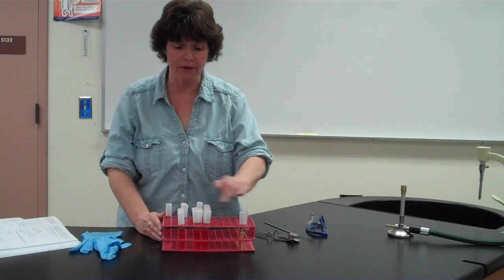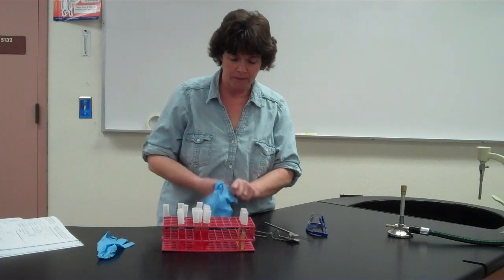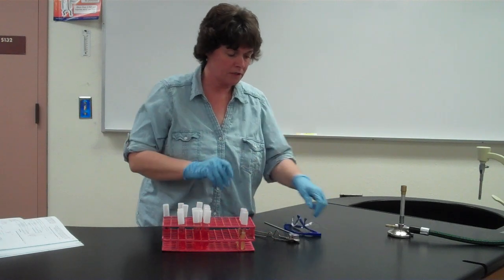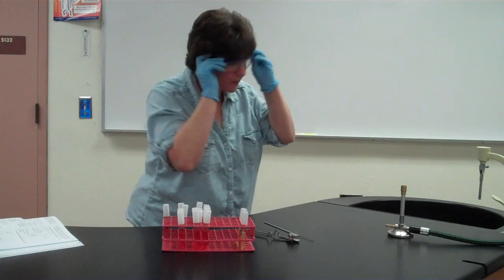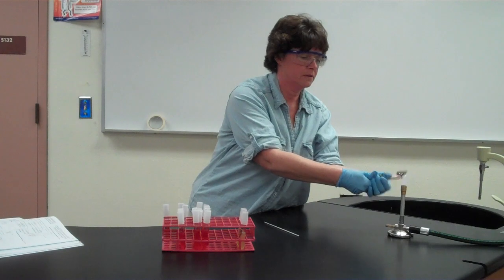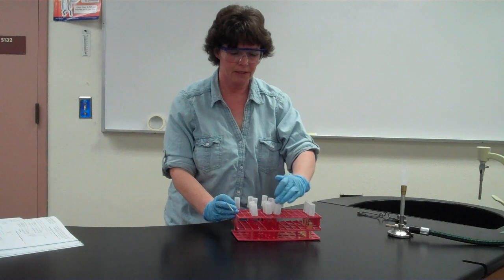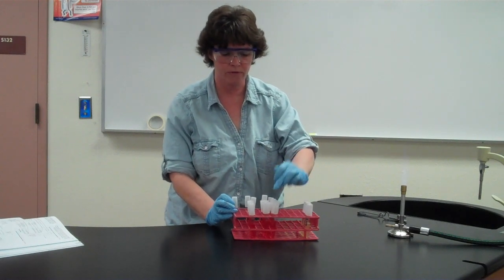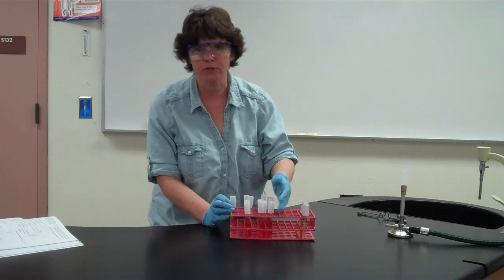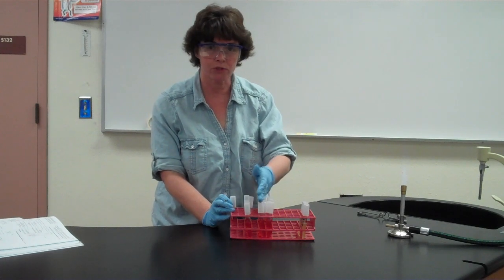So then we're going to be going from here into these tubes. So as always, we're going to use our safety. Put on our gloves and goggles before we ever light our Bunsen burner. Light our Bunsen burner there. And so remember, I already have these labeled, and I know that I'm going from this bacteria, and I have the sucrose here, I have the dextrose here, and I have the lactose here, or whichever order you would have them in, okay? Just make sure that you know what you're putting into them and what sugar it is.